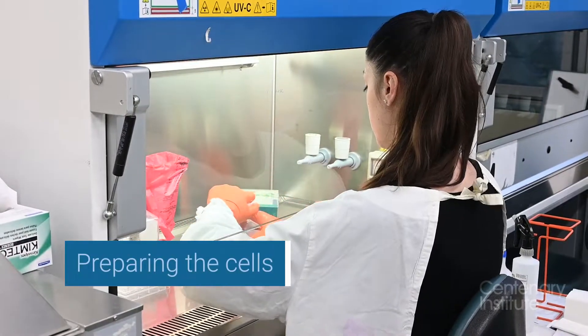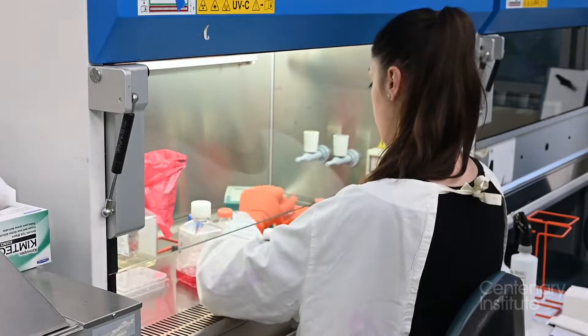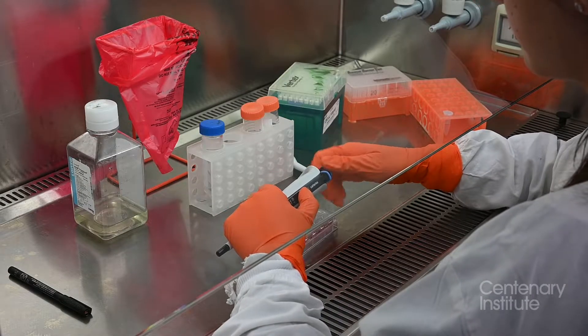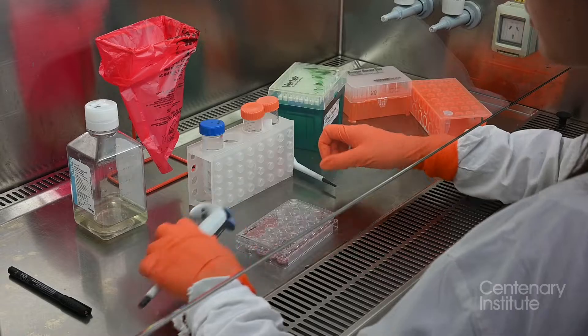We prepare the plate with immune cells. I measure these using a pipette, which allows me to select a precise amount.